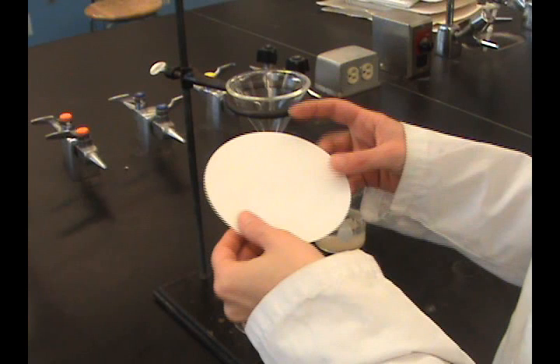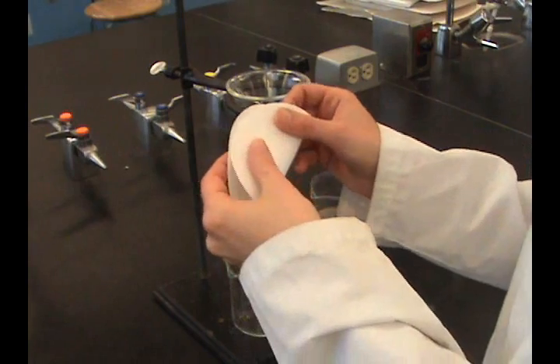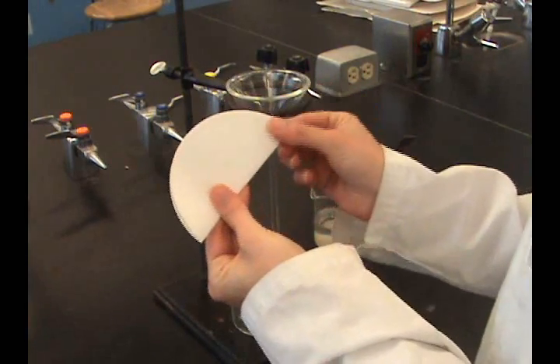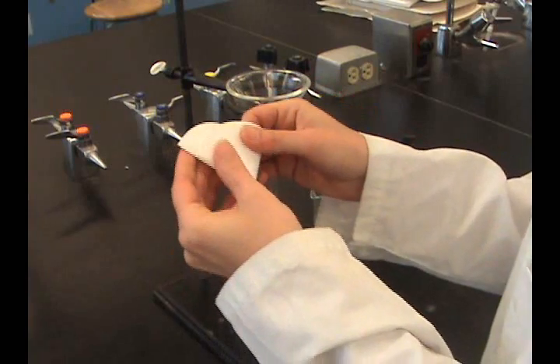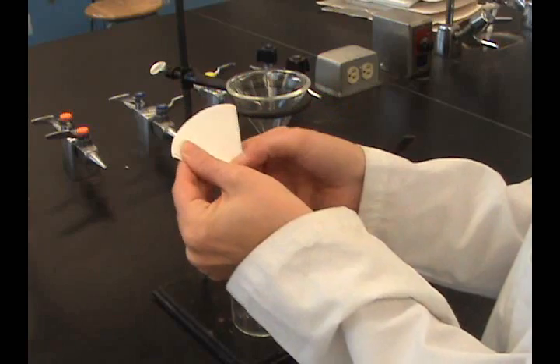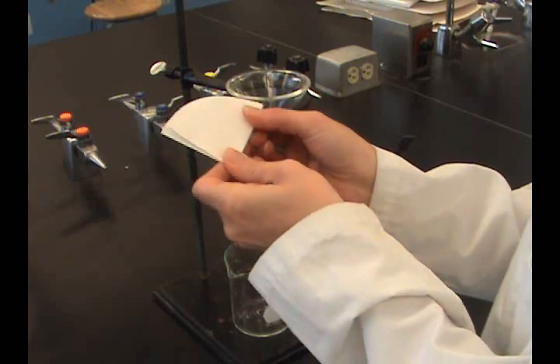If igniting the filter paper after filtering, make sure the paper is ashless. To properly fold the filter paper, fold it in half then quarters. Allow the second fold to be off-center to form a cone that will leave a small space at the bottom for better liquid drainage.